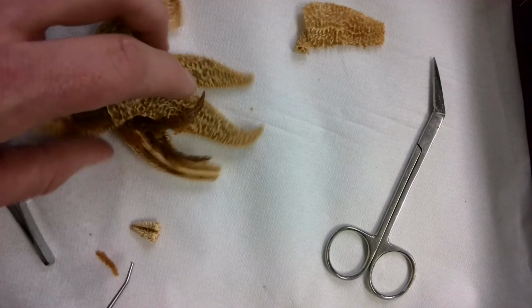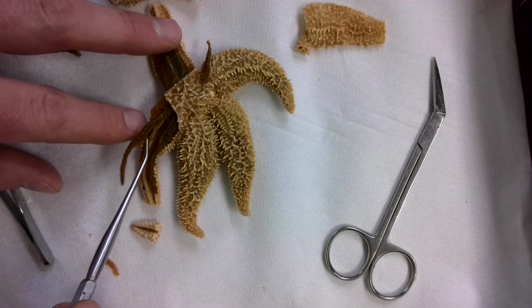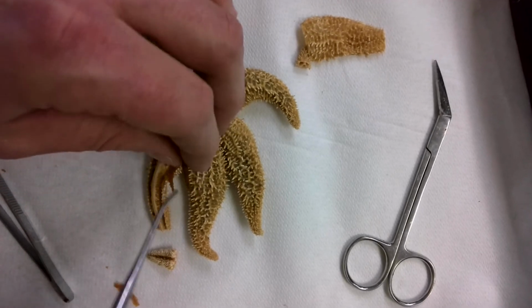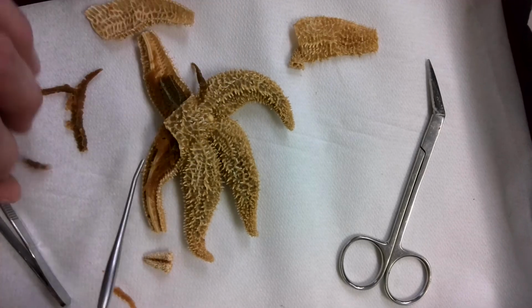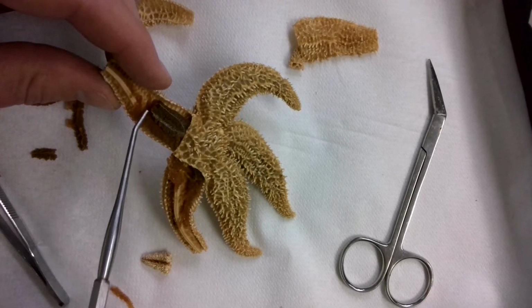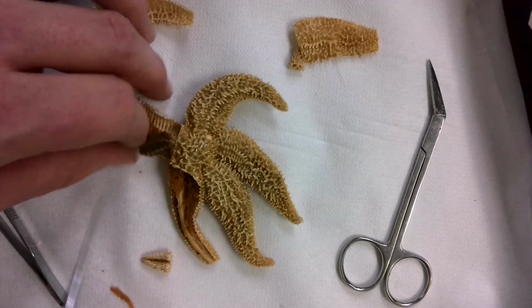So now going back over and looking at my dissected rays, the first structure that you can see right here, this brown stuff, this is called the digestive gland. So if I lift the digestive gland out of the way, I'm just going to remove it there. See, I'll remove it on this side too. You notice a difference in texture and color. Underneath that, this right here, these are the gonads. So these are the reproductive structures of the sea stars. So you can see a difference right here. I've got some digestive gland left. Then when you lift that off, you've got this other structure right here. That would be the gonads. So we've got 2 other structures there.